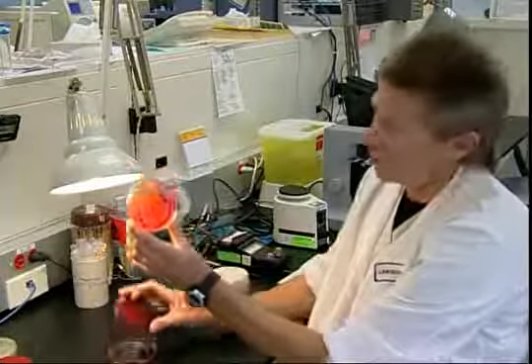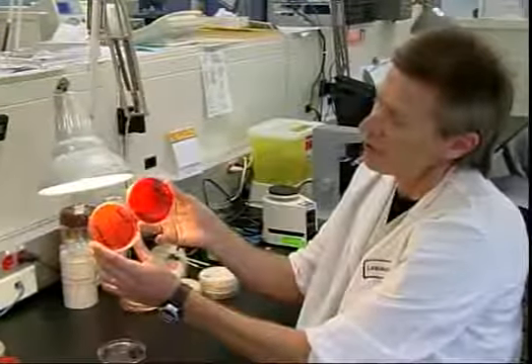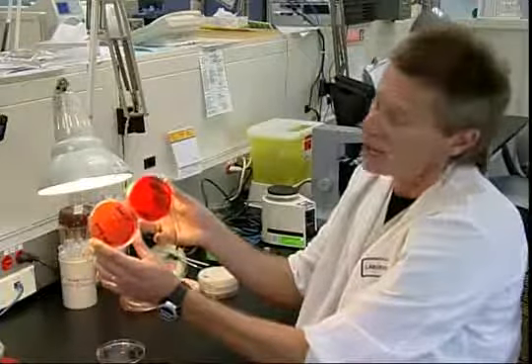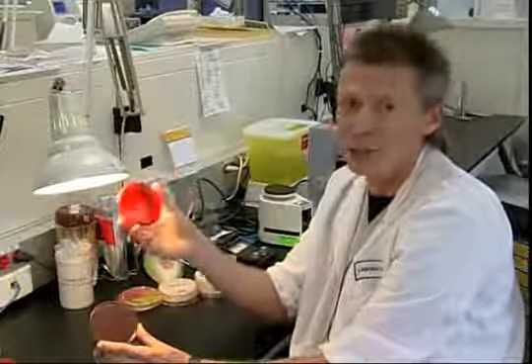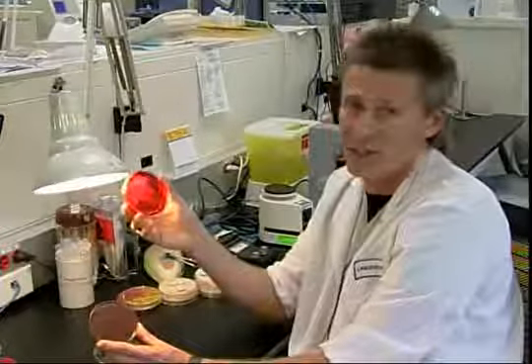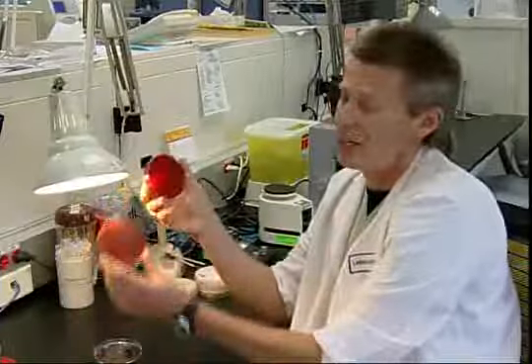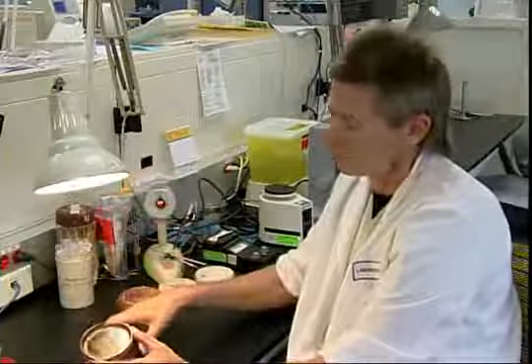Because we also set it up on a CNA plate, those colonies are clearly visible and clearly accessible. This plate is selective because we use antibiotics, colistin and nalidixic acid. That inhibits the Proteus and allows the gram-positive organism to grow.